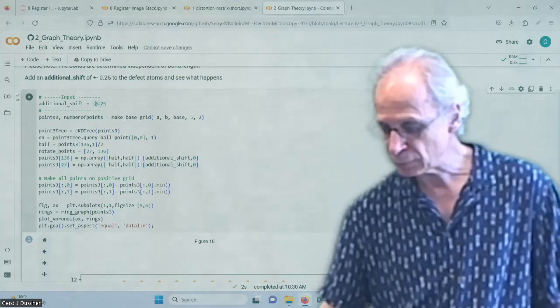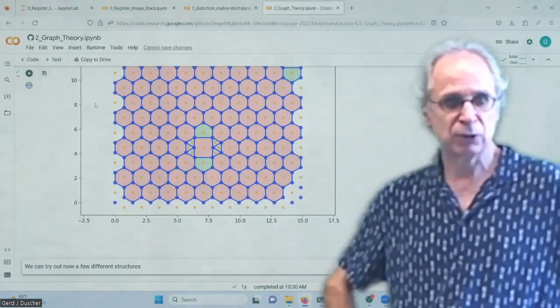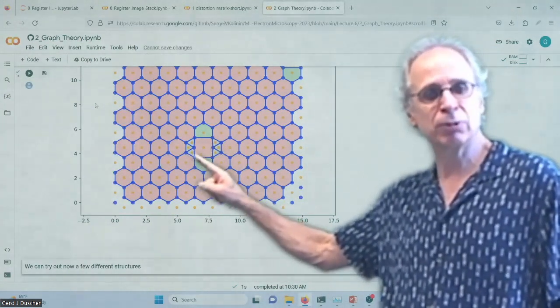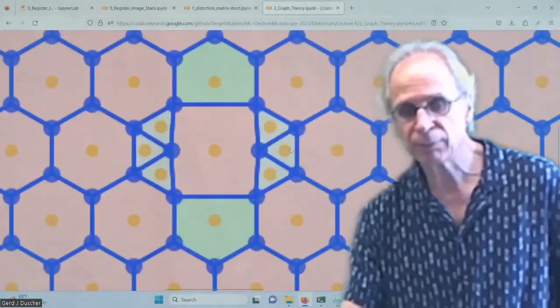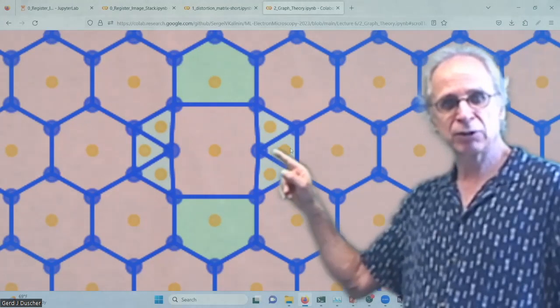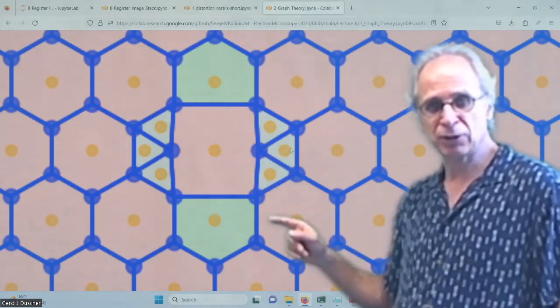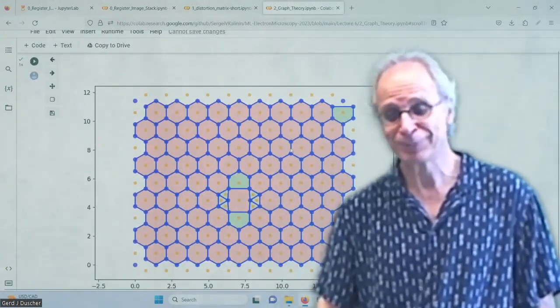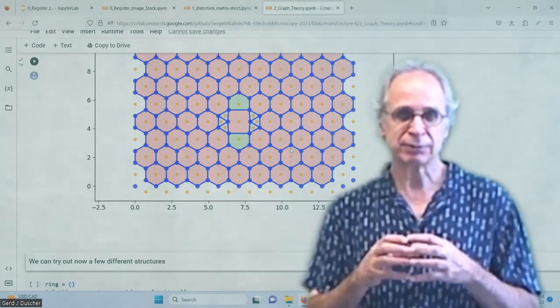If you do it too large, what happens then? So I put 0.35 in here. Okay. Is that reasonable? Yes. So here is my convex polyhedra. No, polyhedra, polygon. And then here I cannot make one. So here it's going a little bit in. So you see, we no longer have a convex one. It's stepped in here. And so now I have 3 triangles instead of a 5-fold ring, and this one is now a 6-fold one. Key thing is no input, and you get your bonds. And it's unambiguous. And the only thing that we are really looking for is convex polyhedra.